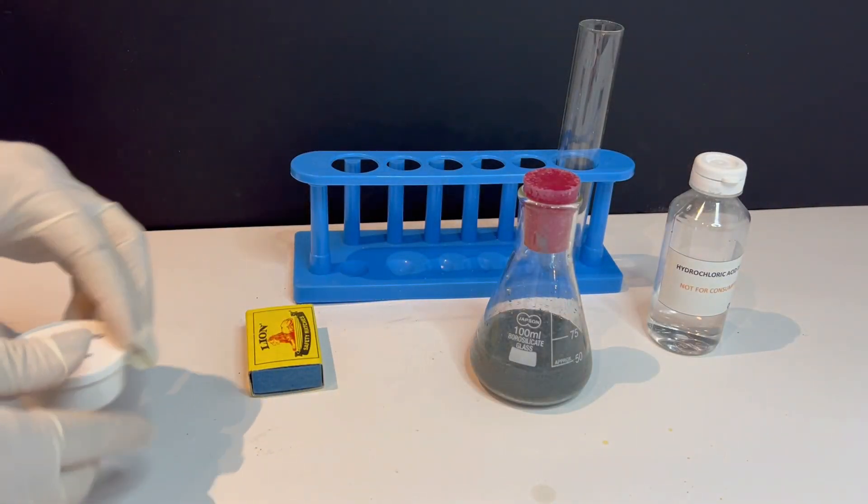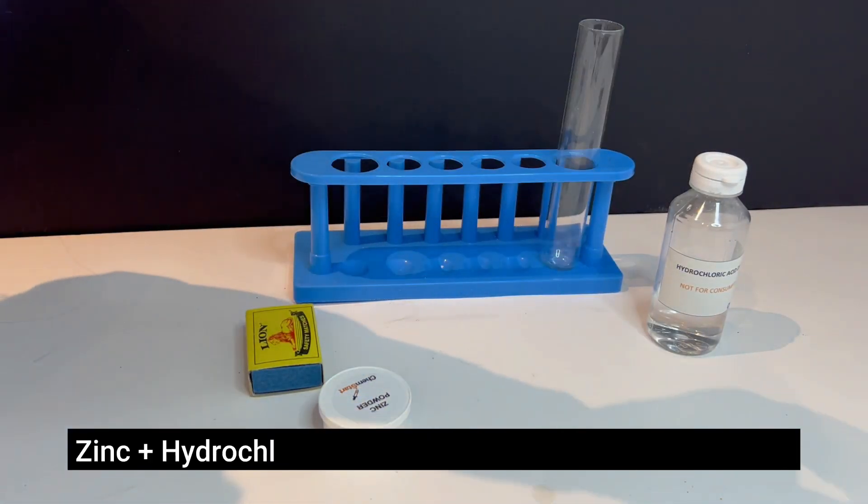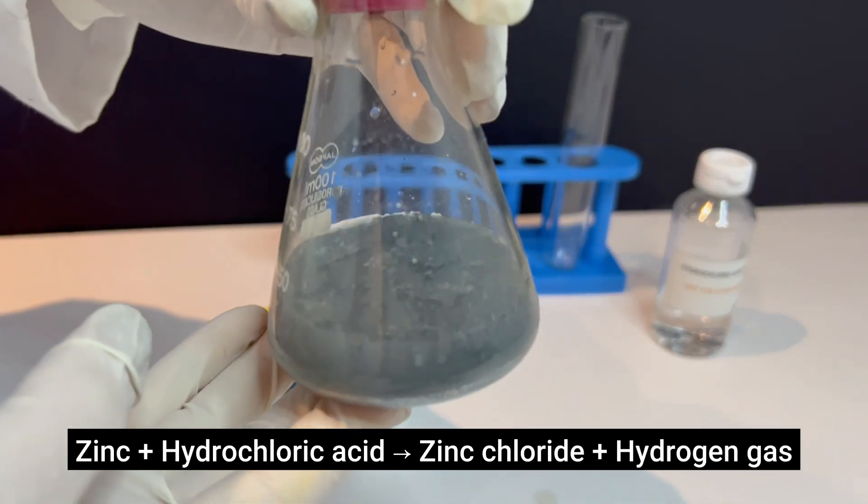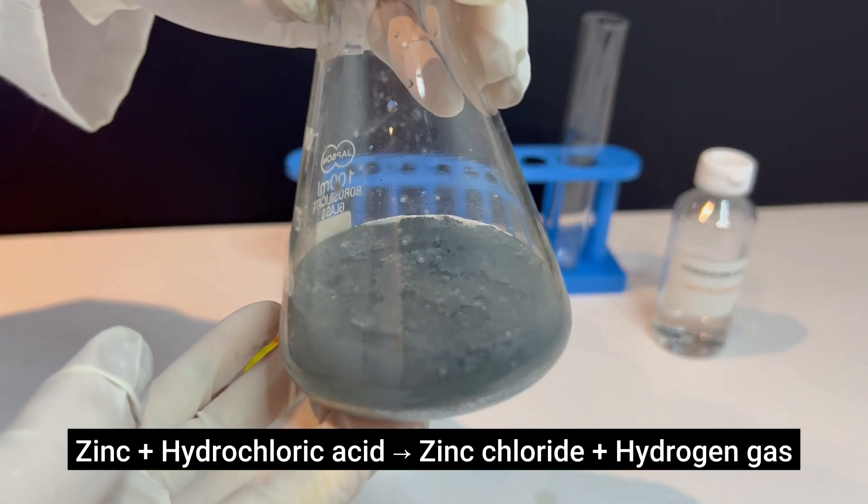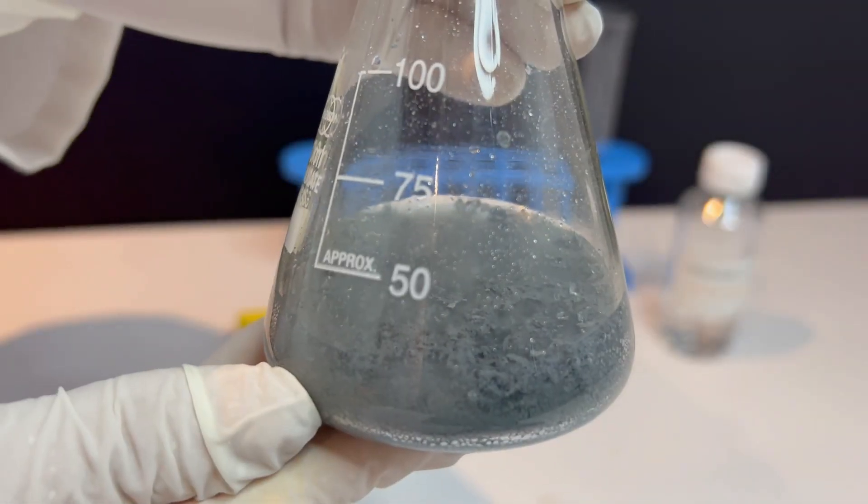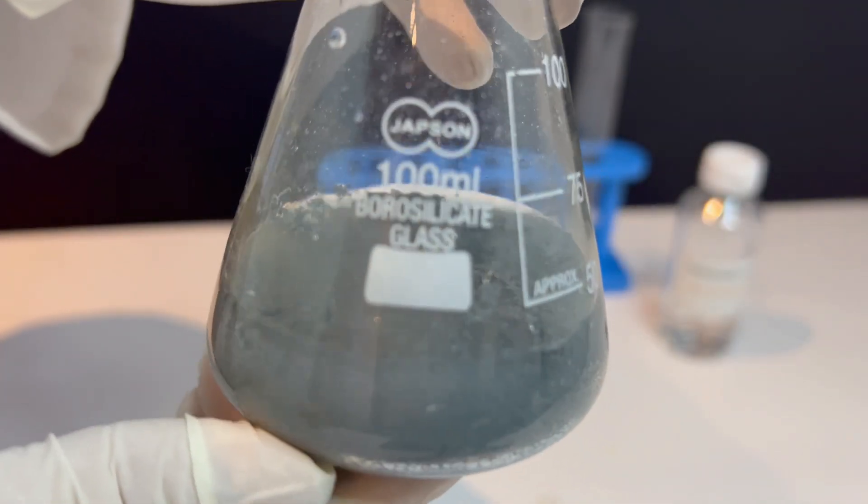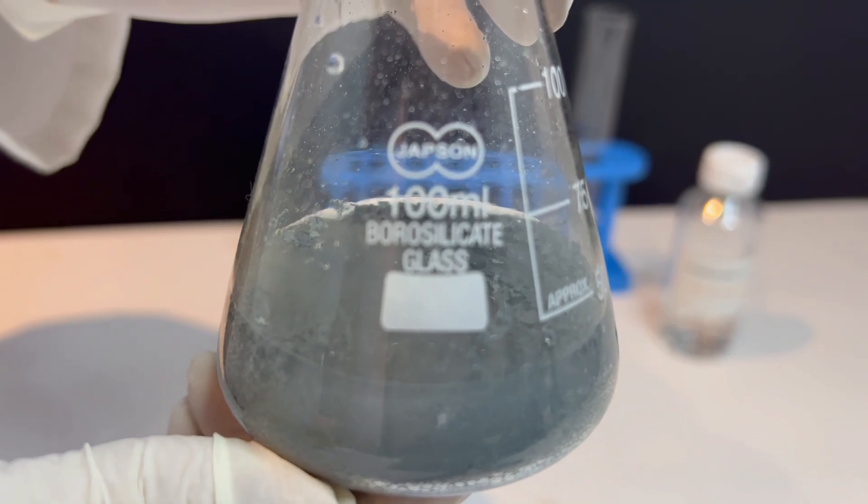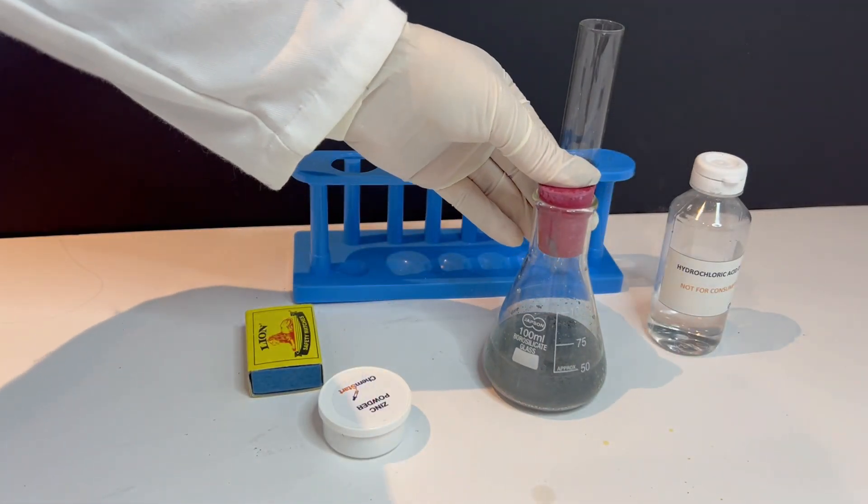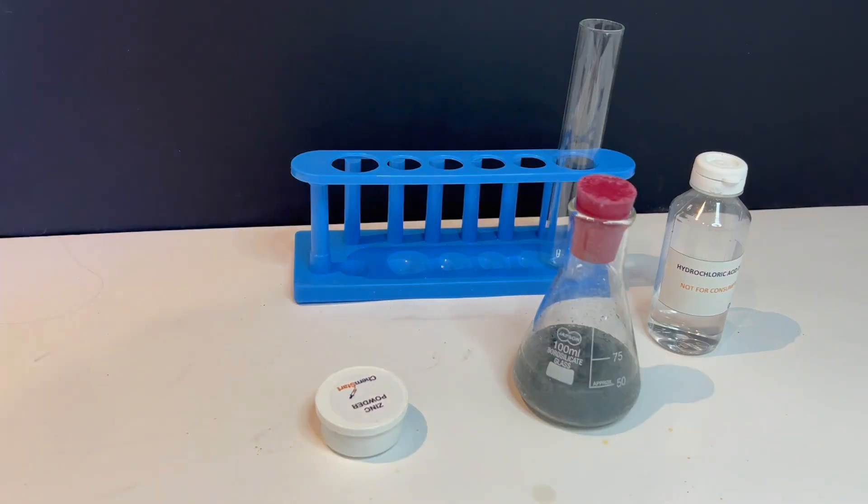Now let's test whether the gas being produced is hydrogen. While the reaction is still bubbling, bring a burning match carefully to the mouth of the flask. Don't insert it into the flask.